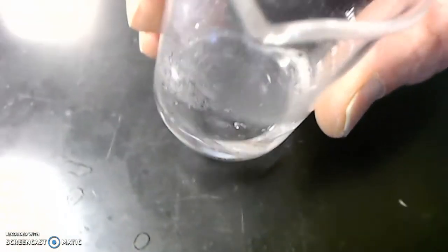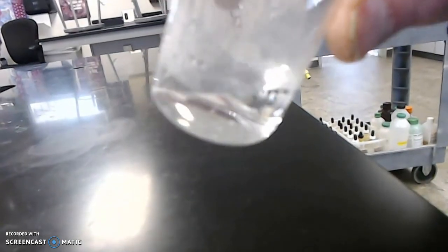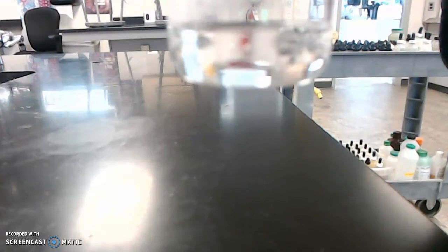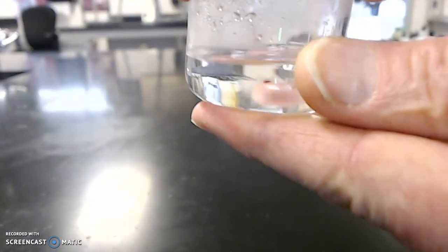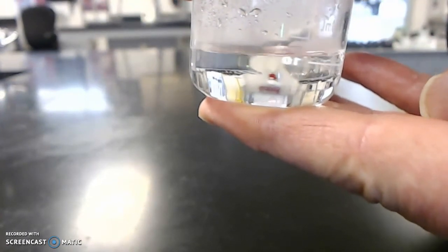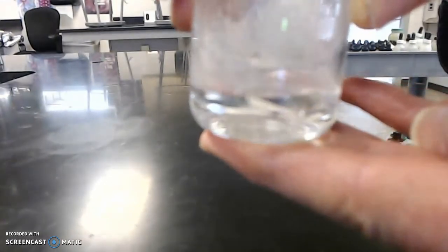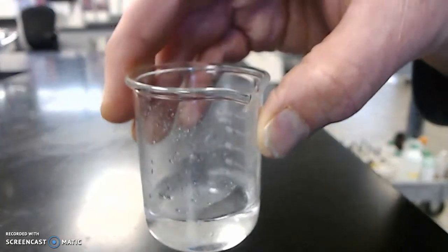But now I've also noticed that, oh my goodness, the magnesium is gone. There's no magnesium, there's no bubbling left. When you look at the side of this, the magnesium has completely dissolved. Another thing I can observe is that the temperature is really warm. So the beaker, the liquid, the acid, has warmed up. So there is the conclusion of part 2.